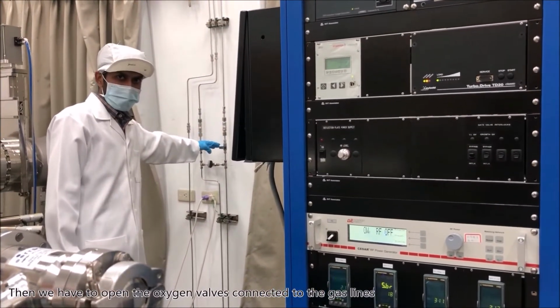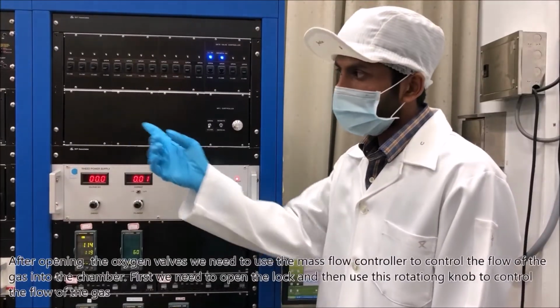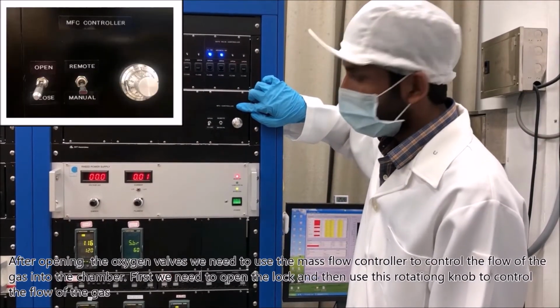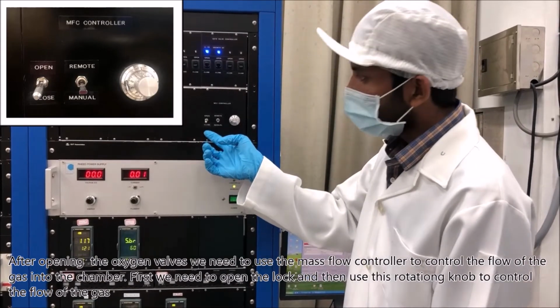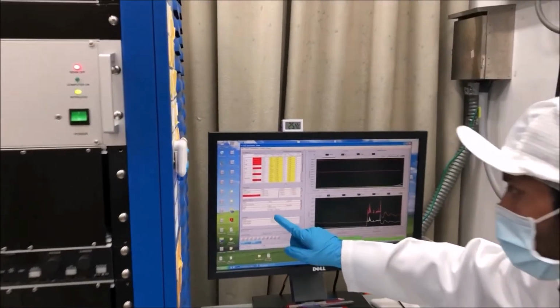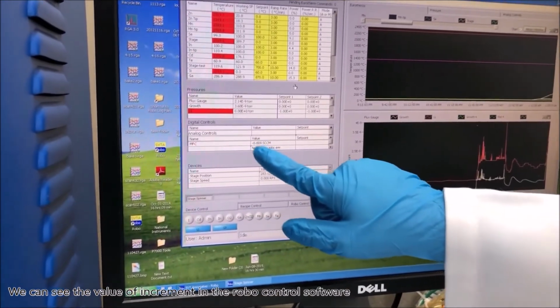Then we have to open the oxygen valves connected to the gas lines. After opening the oxygen valves, we need to use the mass flow controller to control the flow of the gas into the chamber. First, we need to open the lock and then use this rotating knob to control the flow of the gas. We can see the value of increment in the robo control software.